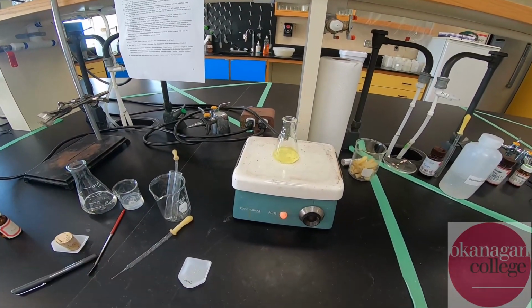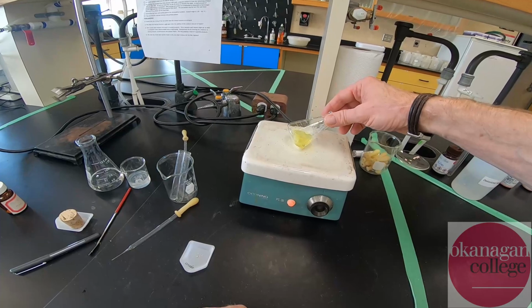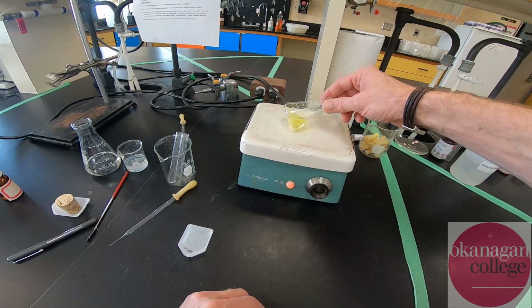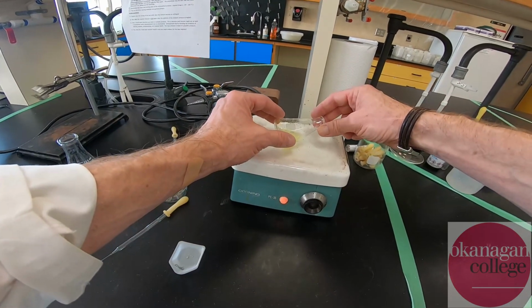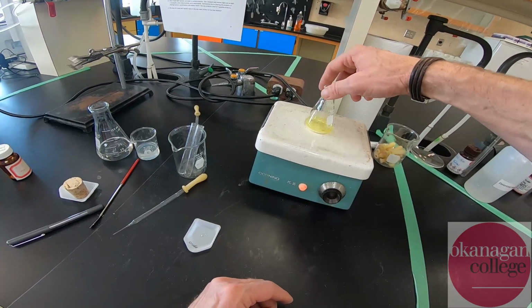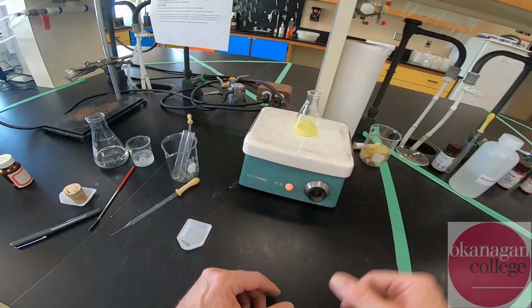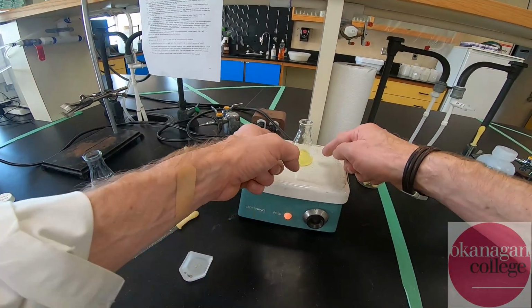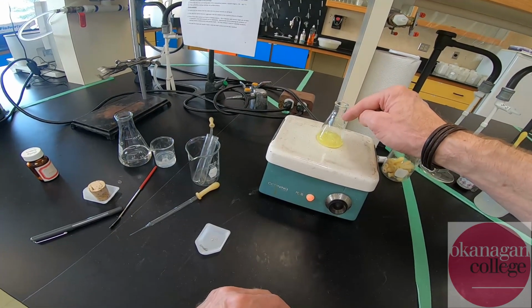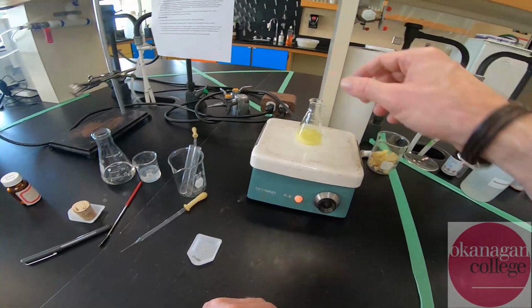Okay, so we've been heating for a couple minutes now. You can see a lot of the material is starting to dissolve. We've got a bright yellow liquid, or supernatant, over top of the crystallized material. What you can do here, carefully, is rotate the flask at a bit of an angle to help rinse down some of the material that was stuck on the neck of the flask. That's not ideal, it's not perfect, and what we'll find is when we get a little closer to boiling, the vapor will condense on the flask and actually rinse down some of this material into the container. All right, so we will get a chance to dissolve all of that material.